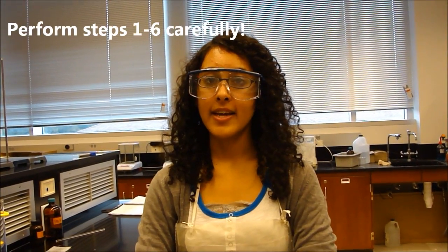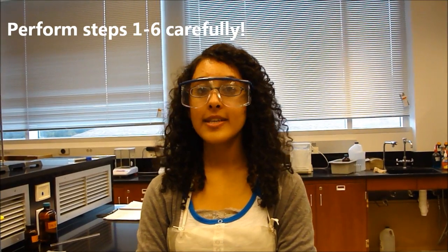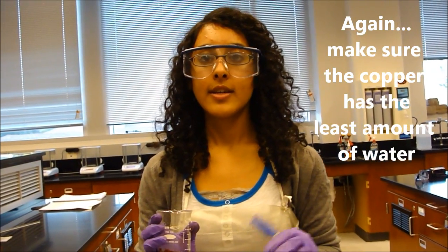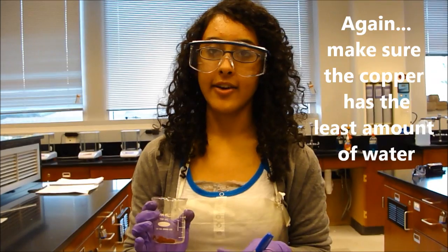It's very important that you perform steps 1 through 6 efficiently, managing your time, because the amount of time it takes for the copper to dry varies. If the copper is still wet in the end, then that can skew your results. So you want to make sure it's dried all the way. To get ready to place it in the oven, label the beakers with your initials to prevent mixing them up with other students' beakers. Drying will take the longest, about an hour or so. So it's very important that the copper is dried all the way so you can obtain accurate results.